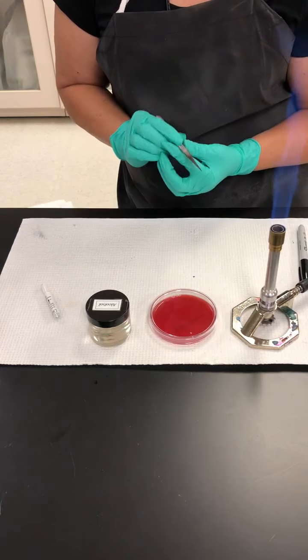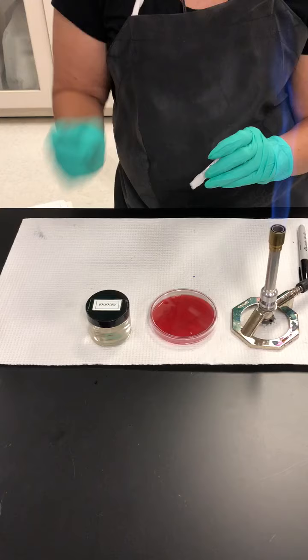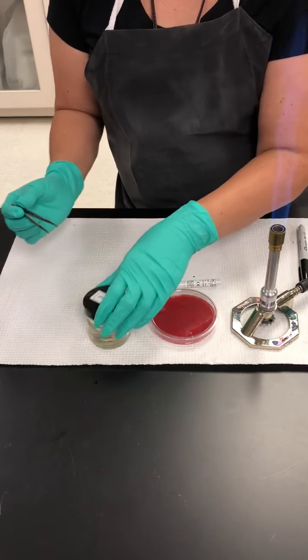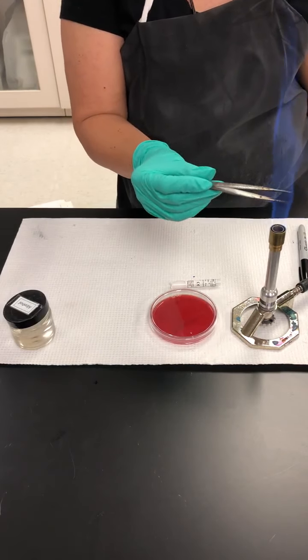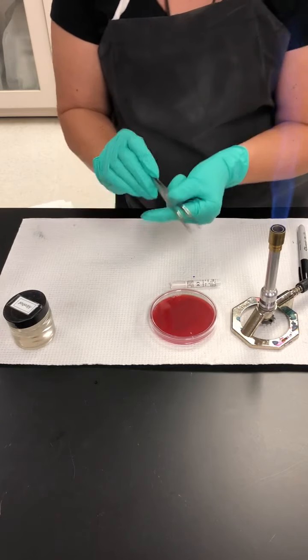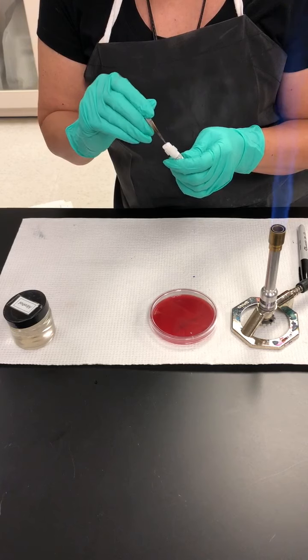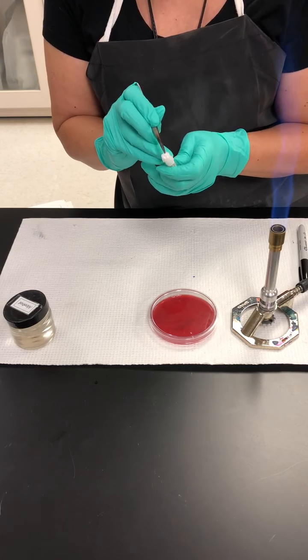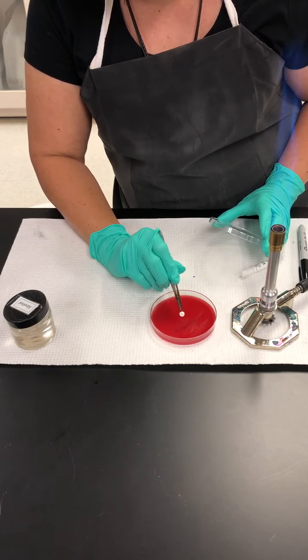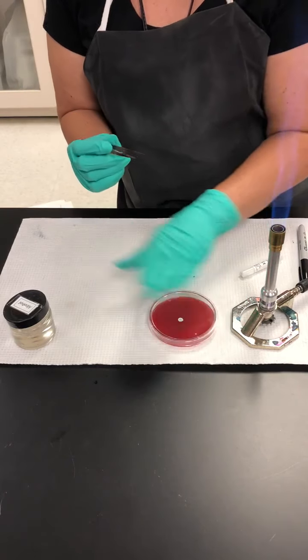And I'm going to transfer the antibiotic disc aseptically by using the forceps and alcohol. I'm going to dip the forceps in the alcohol. I'm going to flame the forceps. You don't have to hold them to the flame because the alcohol is going to burn off. I'm going to transfer a disc from the dispenser. You actually just have to pull them out, place it on top of the bacterial culture. I like to tap it a little bit, but you don't have to jab it in there.